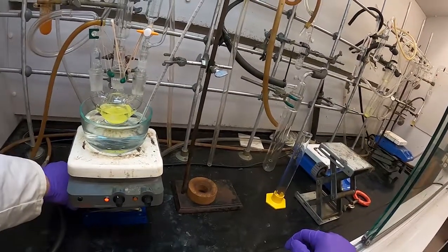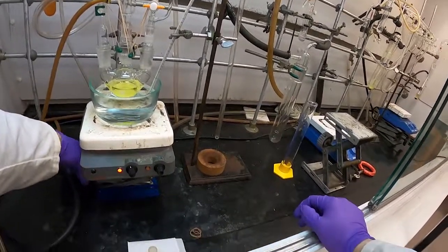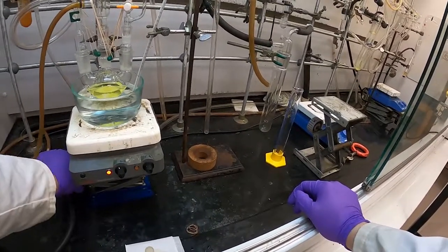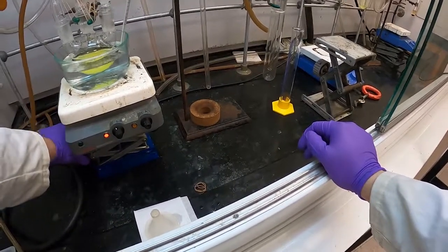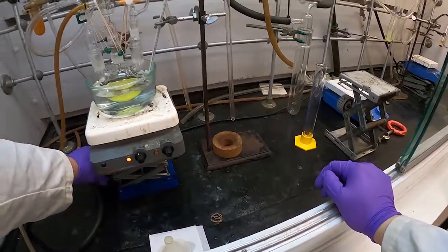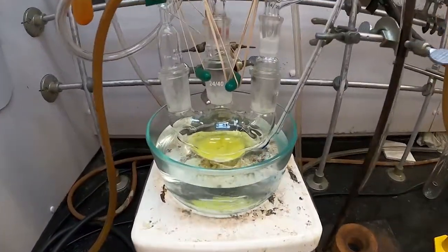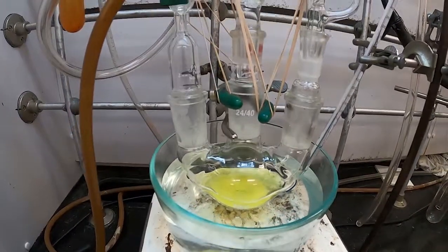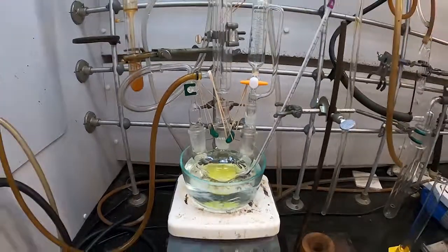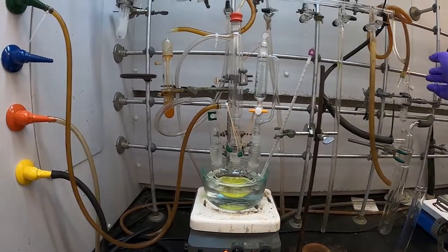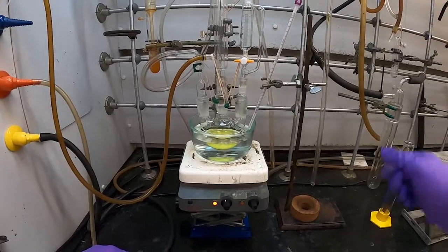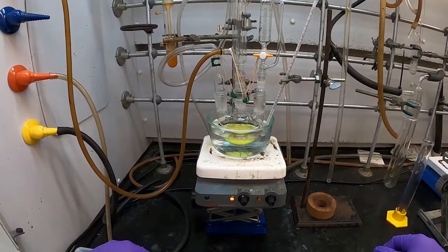I'm going to raise this up a bit as well. And the water bath level is now level with the level of the solution in the flask. I'm going to purge this or flush this with nitrogen for a bit and I'll be back when we're ready to move on.